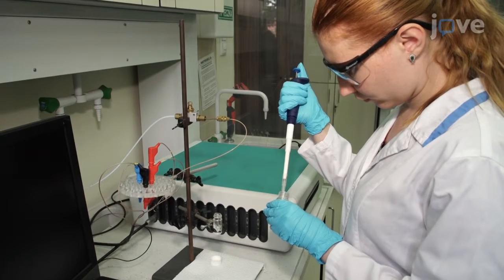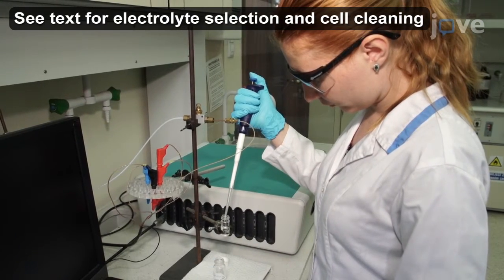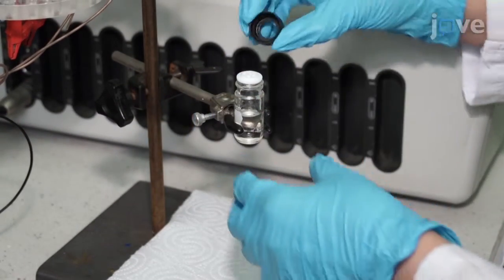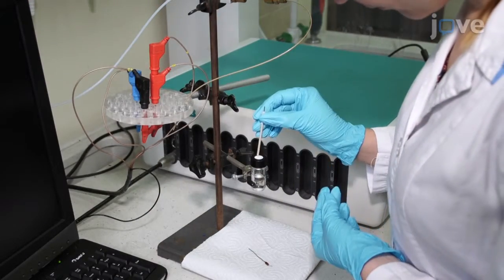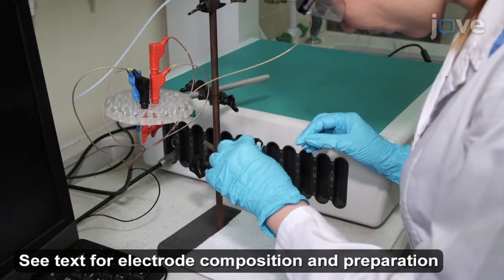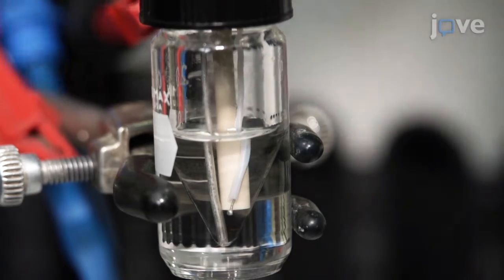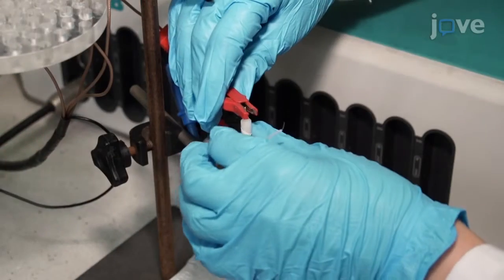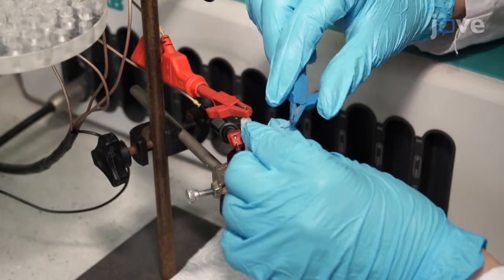To begin the CV procedure, fill a clean electrochemical cell with 1.5 milliliters of electrolyte solution and cap the cell with a polytetrafluoroethylene electrode holder. Insert working, auxiliary, and reference electrodes into the cap, with the working and reference electrodes as close together as possible without touching. Ensure that the electrodes are immersed in the electrolyte. Then connect the electrodes to a potentiostat, being careful not to let the connectors touch each other.